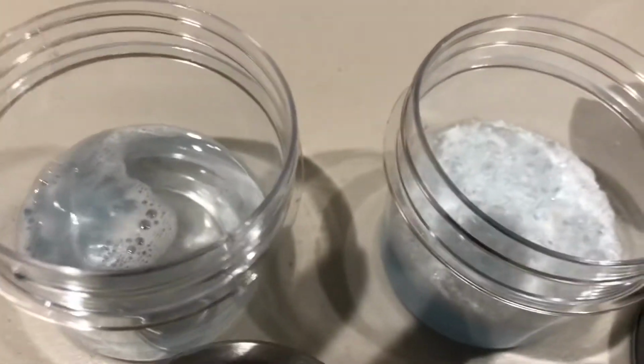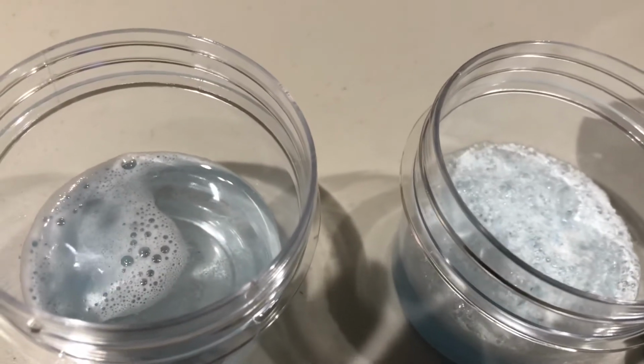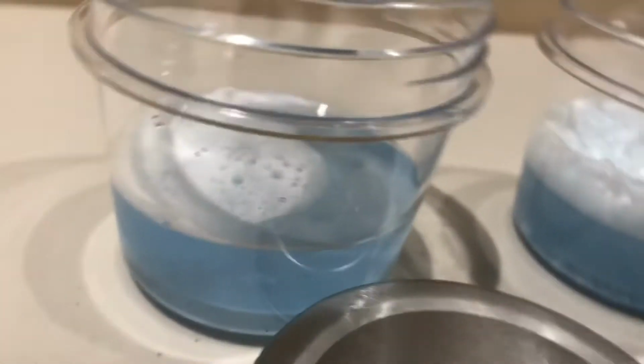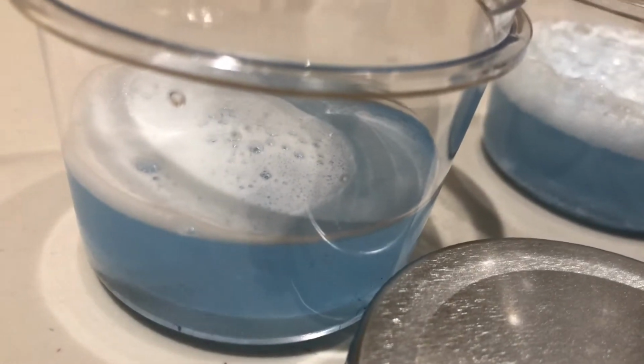Okay, we're looking at both of them simultaneously. We see gas being evolved in the low surface area one. We also see gas being evolved in the higher surface area one. Now let's look at the amount of bubbles. The amount of bubbles for the low surface area one, the whole pill, is there, okay? It's not much, because you can see the pill still floating there, right?